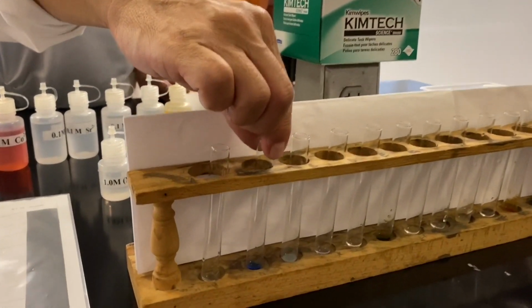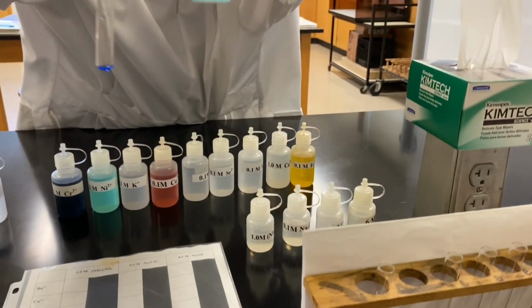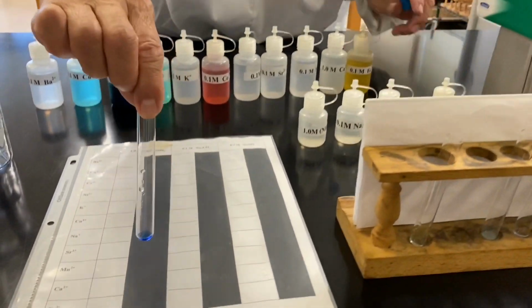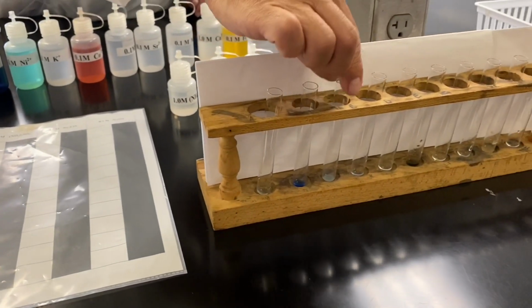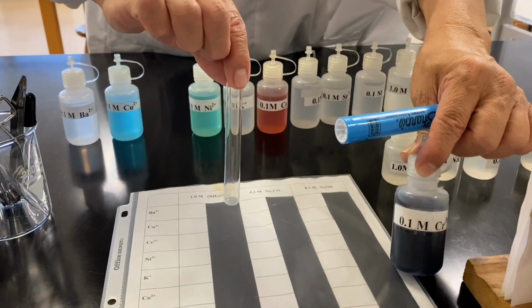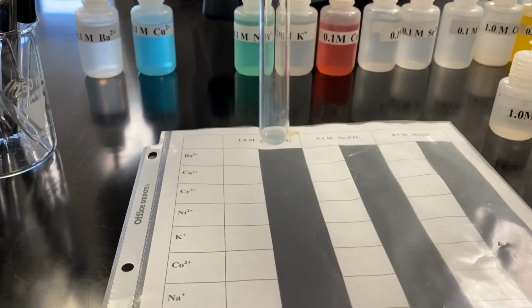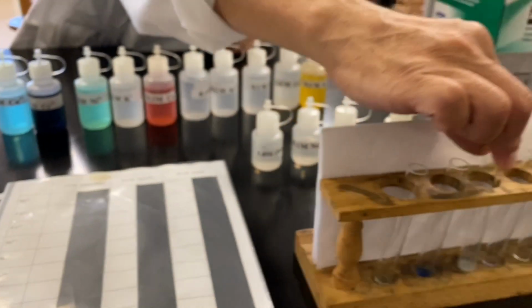For example, our copper 2 ion is no longer sky blue, no longer clear and colorless, and now we have this very deep royal blue color formed. For our chromium 3, it is no longer deep violet blue and changed to this cream and off-white color, but also with precipitate formation.